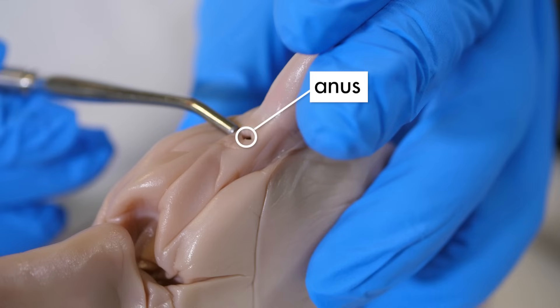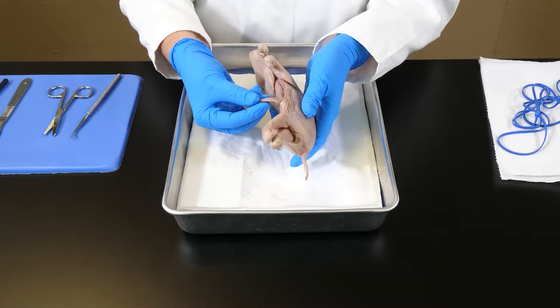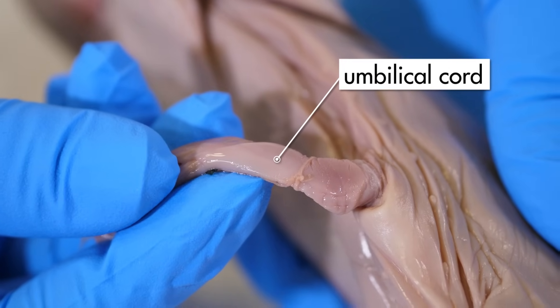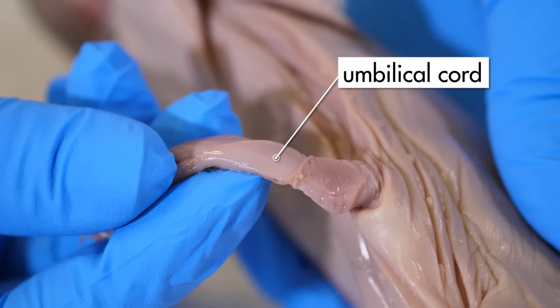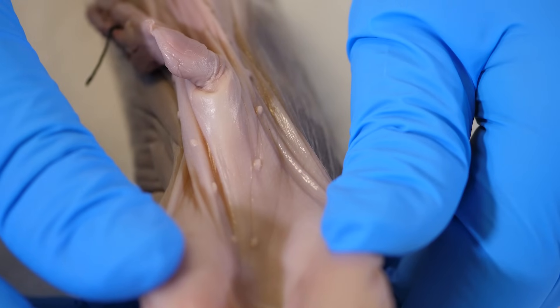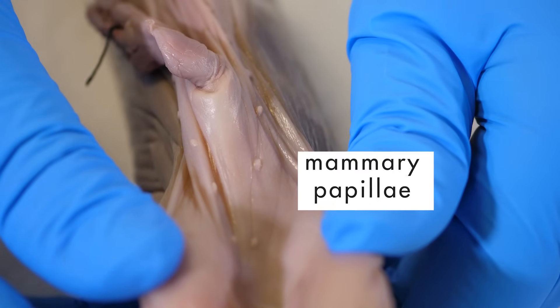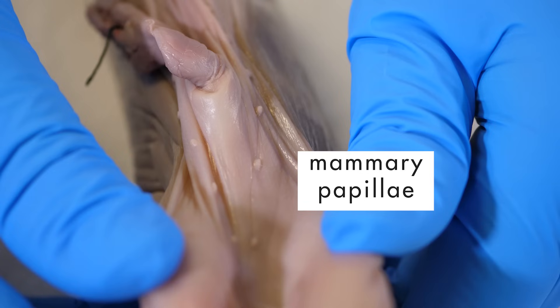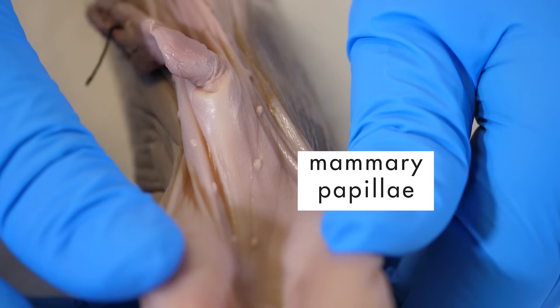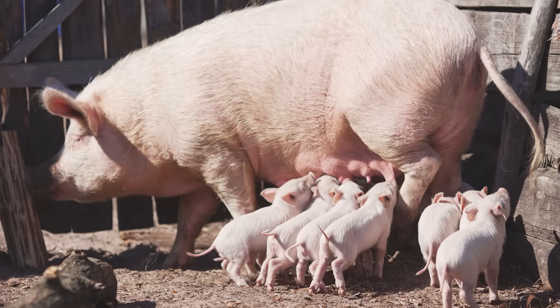Just below the tail is the anus. On the ventral surface is its umbilical cord, which attaches the fetal pig to its mother's uterus. Two rows of bumps are also visible on the pig's ventral side. These are the mammary papillae. Both male and female pigs have mammary papillae, but only the female pig develops mammary glands. Mammary glands are another feature distinctive to mammals.